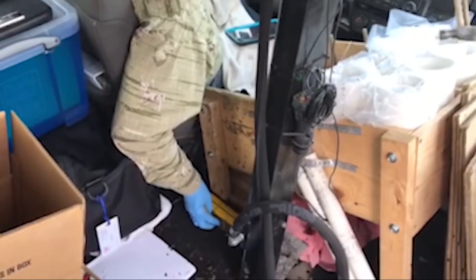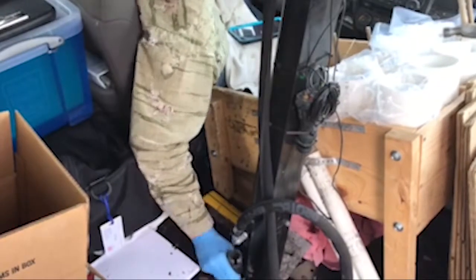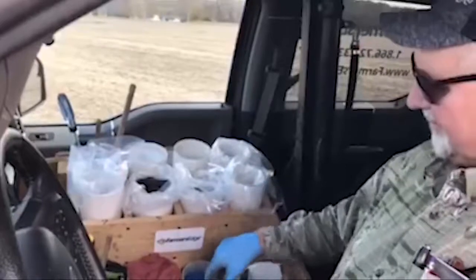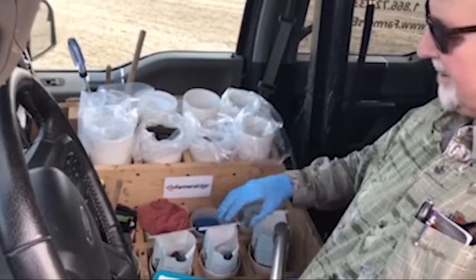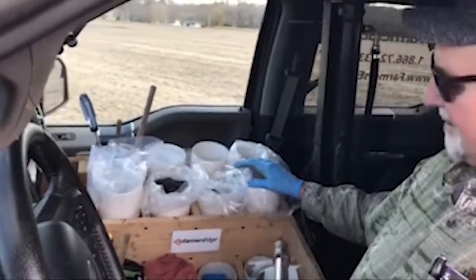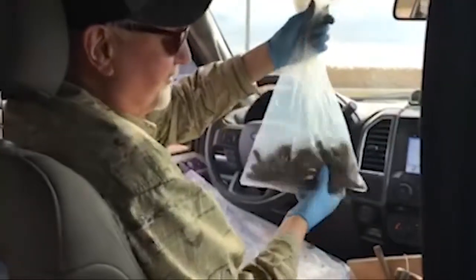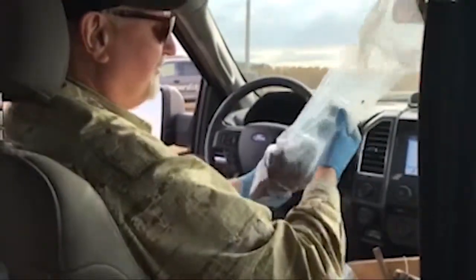The cylinder will go down and take the probe down 24 inches, and everything works the same every time, so you get a consistent sample depth each time. The top zero to six inch soil bags are here on the bottom, and the subsoil bags are up on the top. This is one of the subsoil bags — the six to 24 inch sample.